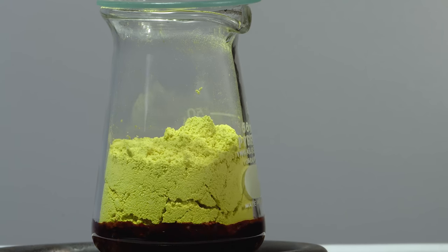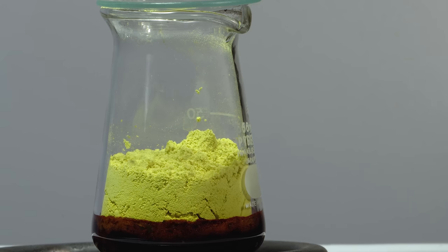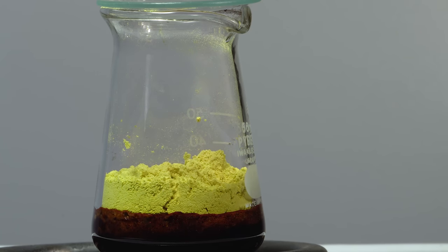This liquid has a density of more than 4 grams per milliliter.